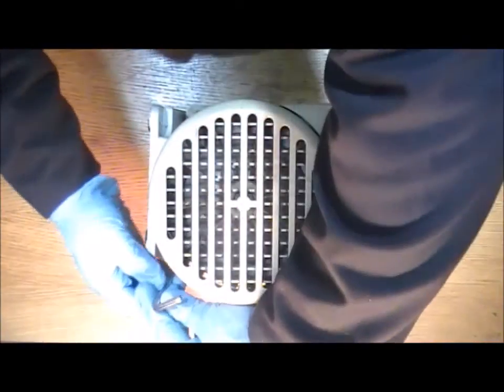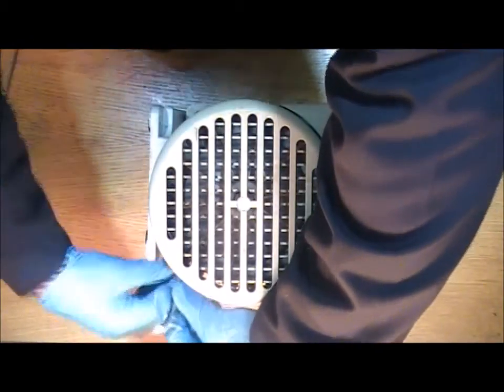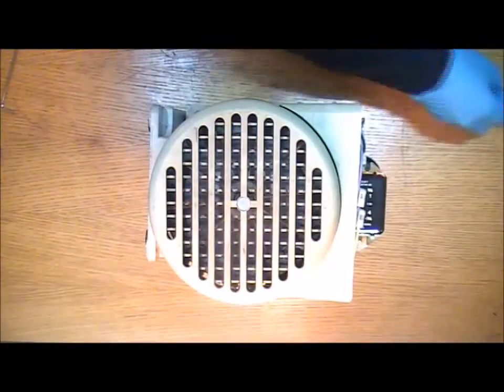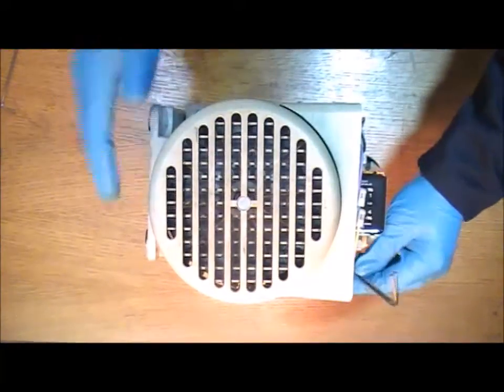Now you can take the base plate off the pump which does make it a little bit easier to get to a few things but isn't actually necessary as such.